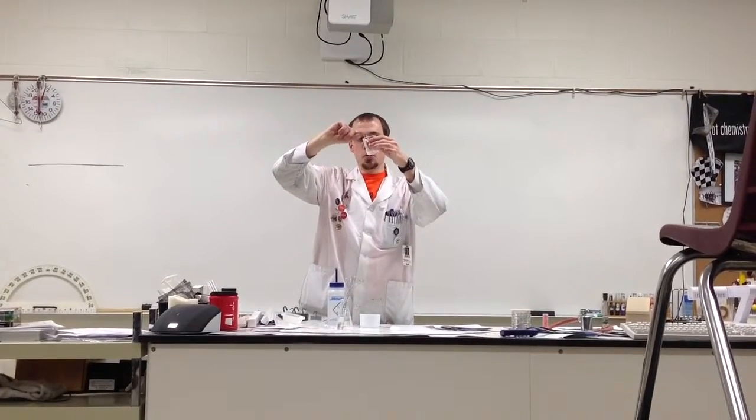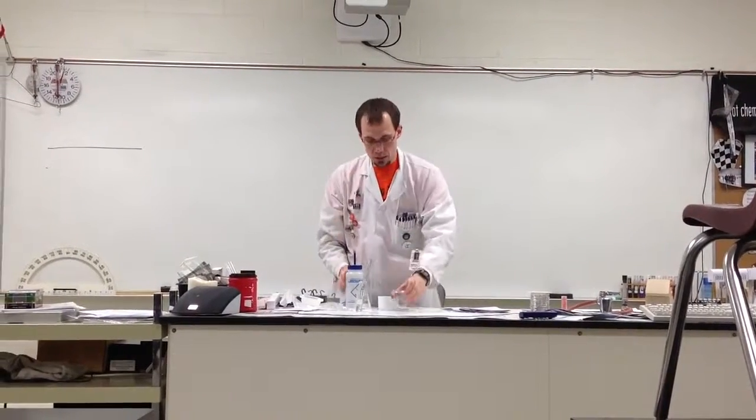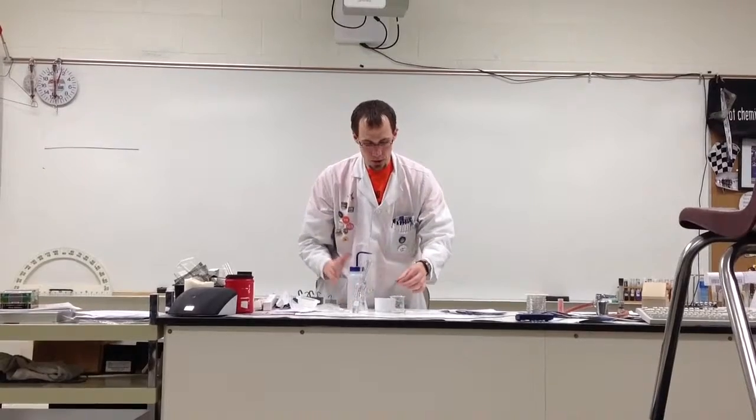Then the rest of the time, you're just going to move it in and out of the solution. It's going to bubble and fizz — it might get a little warm. You just have to do it, in and out, in and out. As you kind of swirl the solution out of the way, you're going to probably start knocking off some of the copper. That's what you want to have happen as much as possible. It might require you to take it out of the solution and spray it with the distilled water at your table, and then continue.